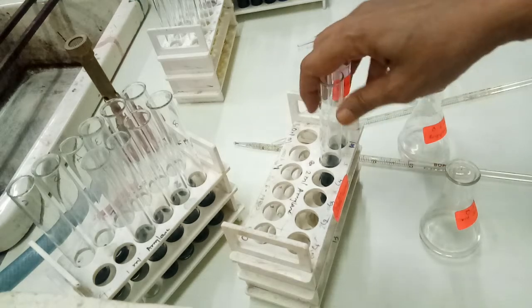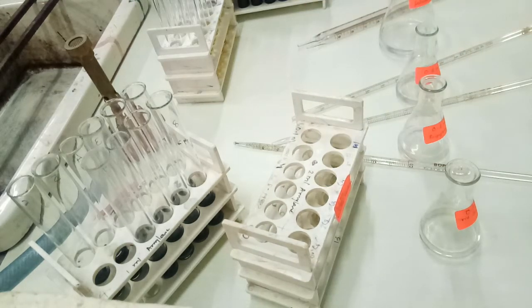But in case of 0.1 ml of enzyme, we have seen that after only 4 minutes the dextrinization was already done. It means that the stage now comes where there is no starch molecule which is not bound with an enzyme molecule. So from now onwards, if you increase the concentration of enzyme, there won't be any effect on the rate of reaction; it will be the same.